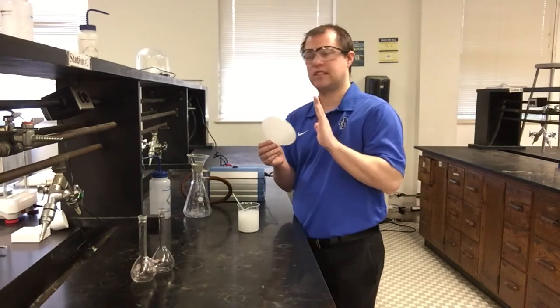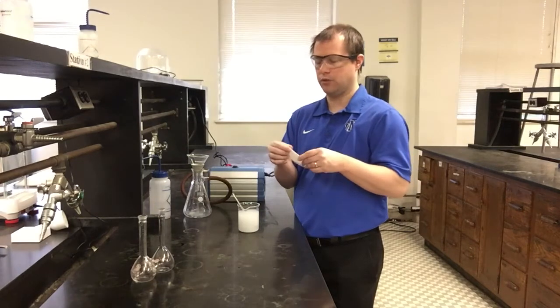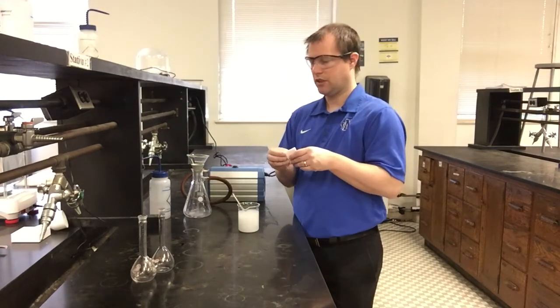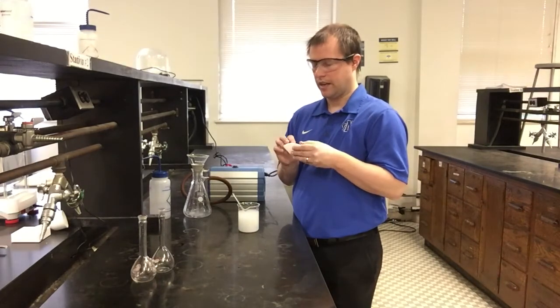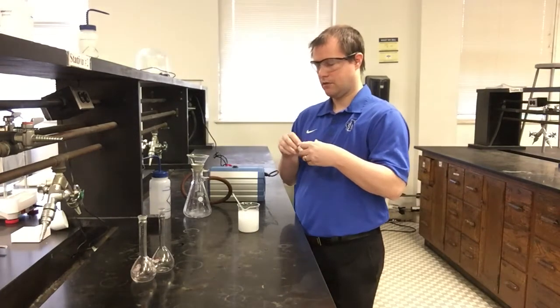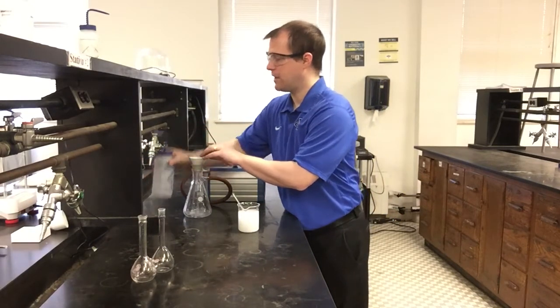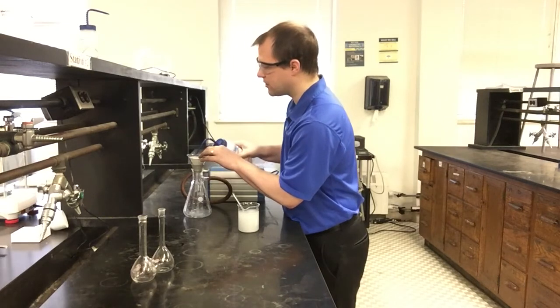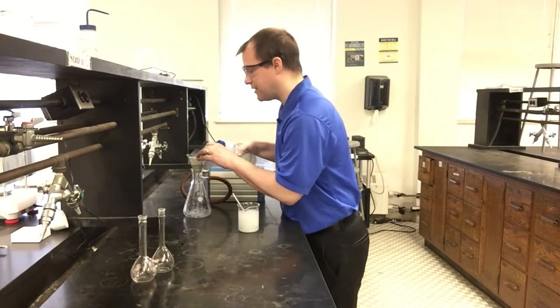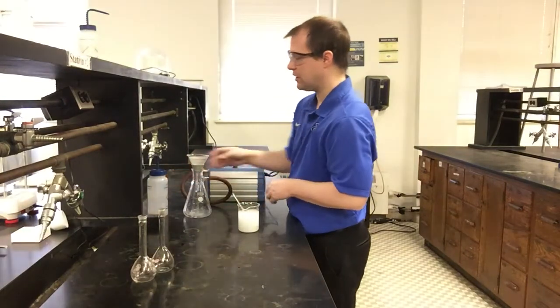And what I'm going to do, same thing kind of similar to what I did for our mixture lab, I am going to go ahead and still fold this over a couple times so that it fits well in my funnel here. And go ahead and open this thing. And then I can go ahead and add it to my funnel. And I'm going to squirt in some water to help make a good seal so that my filter paper stays kind of attached to the walls of the funnel. And you're going to see some water kind of slowly drip through.